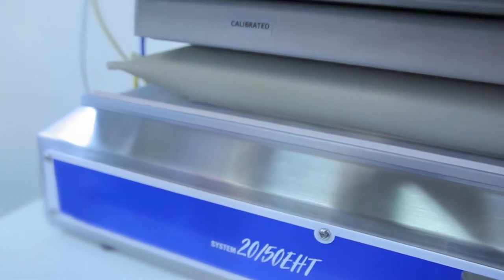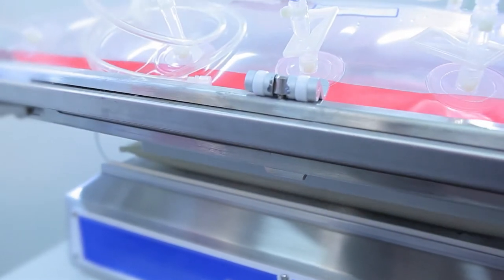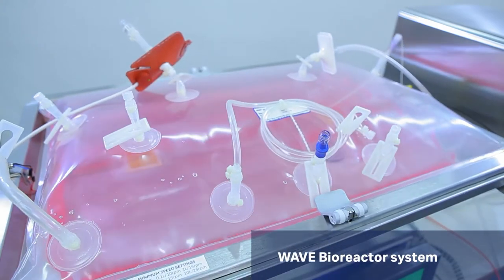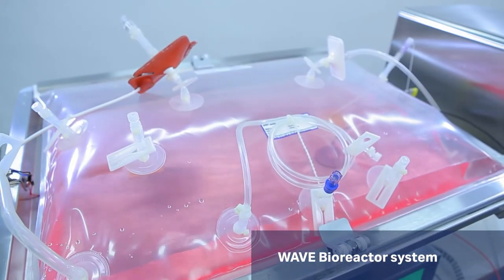The Wave Bioreactor system, comprising the rocking unit and the cell bag bioreactor, is a part of the platform and designed for various cell culture applications.